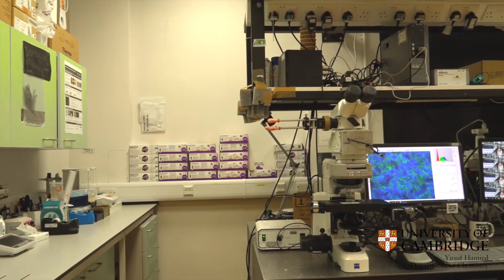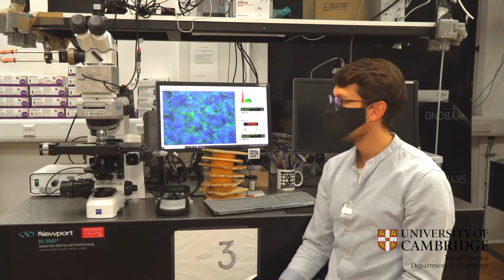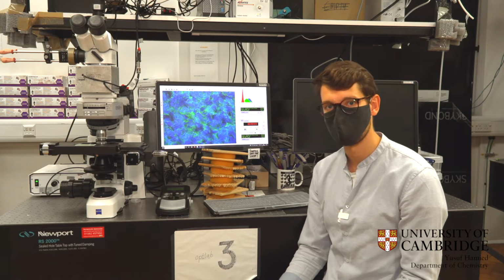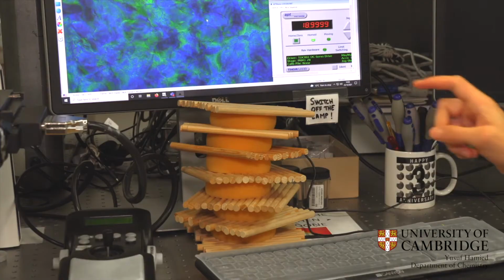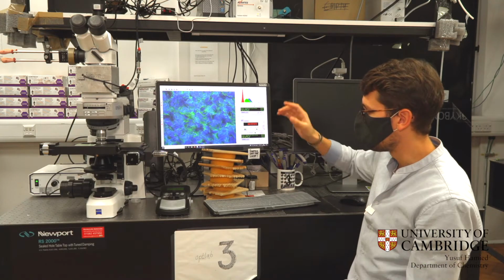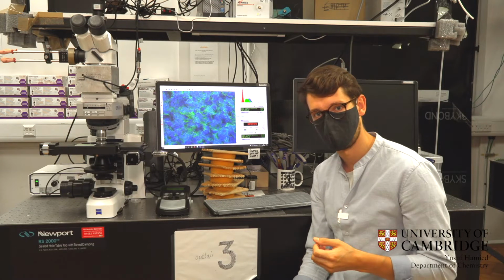In this lab, we characterize the visual appearance of our samples using optical microscopy and spectroscopy. So on the microscope here, we have a film made of cellulose nanocrystals, which are rod-shaped nanoparticles that we extract from natural cellulose. If we could zoom in and see the structure of the film, it would look something like this, with these layers of rods all stacked together in a left-handed configuration. And as a consequence, this structure only reflects what we call left circular polarized light.